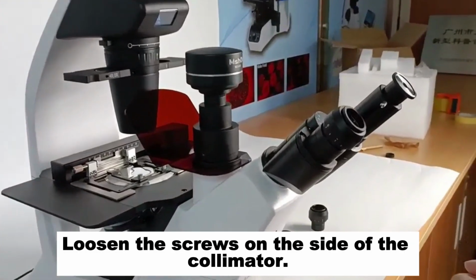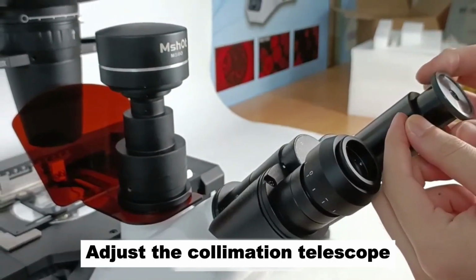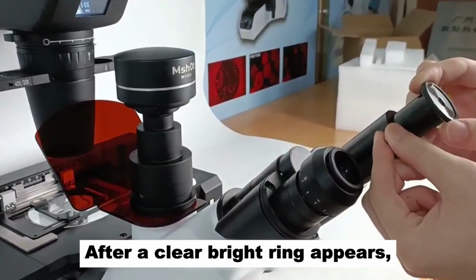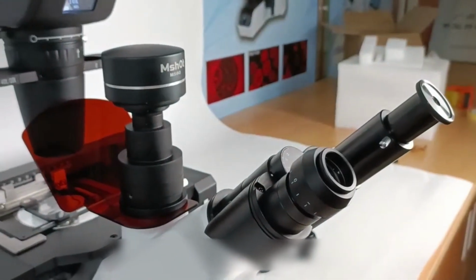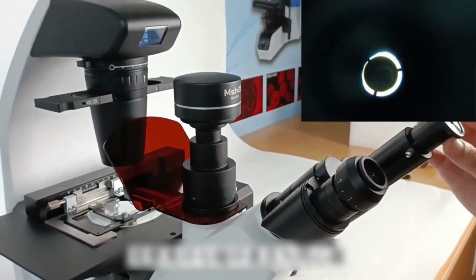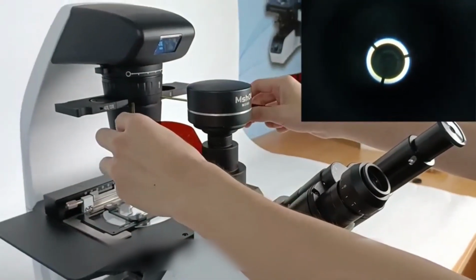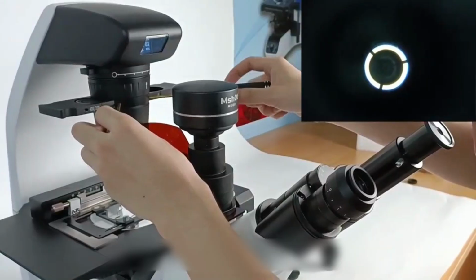Loosen the screws on the side of the collimator. Adjust the collimation telescope until a clear bright ring appears in the field of view. After a clear bright ring appears, tighten the side screws. Observe whether the bright and dark rings are concentric. If not, use a hexagon screwdriver to adjust the two screws above the phase contrast insert, until the two rings under the eyepiece become concentric.